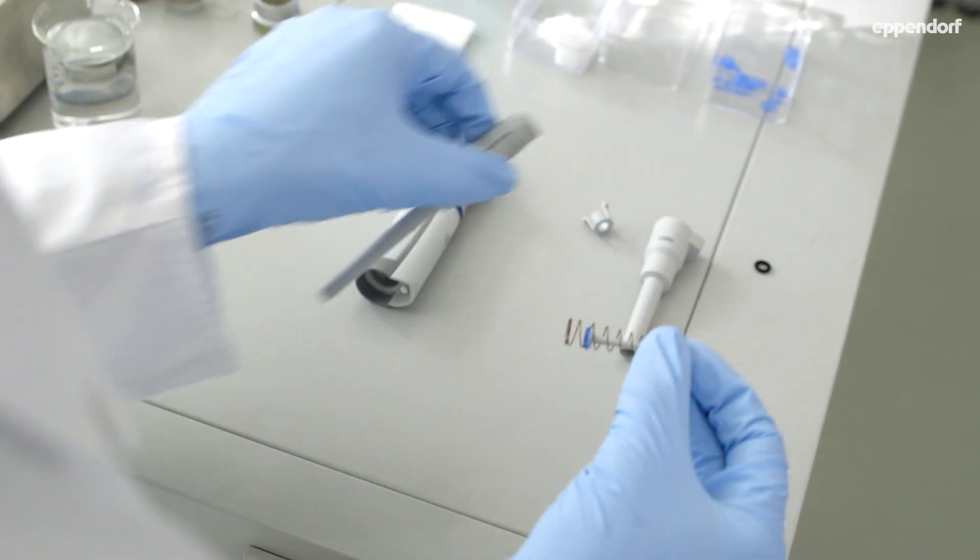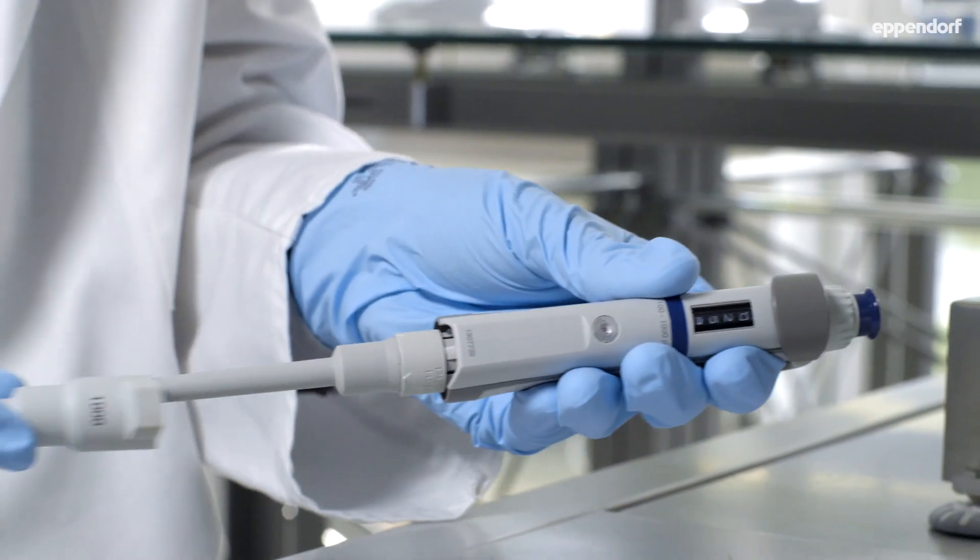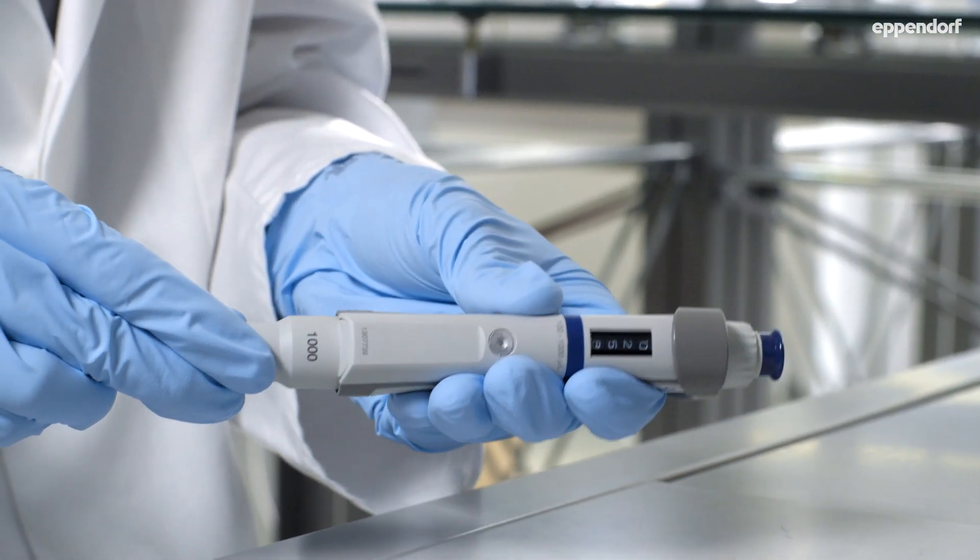Our recommended service period is monthly to yearly, depending on the type of pipette and application and frequency of use.